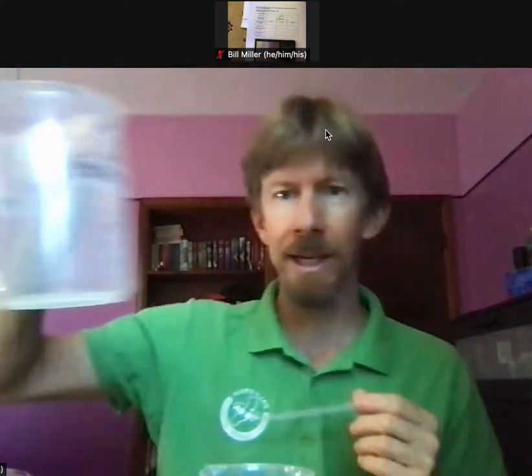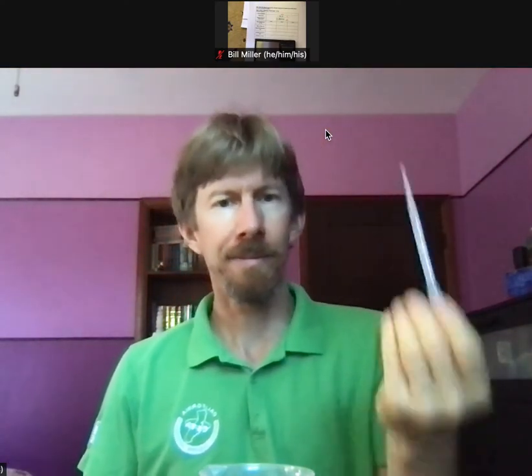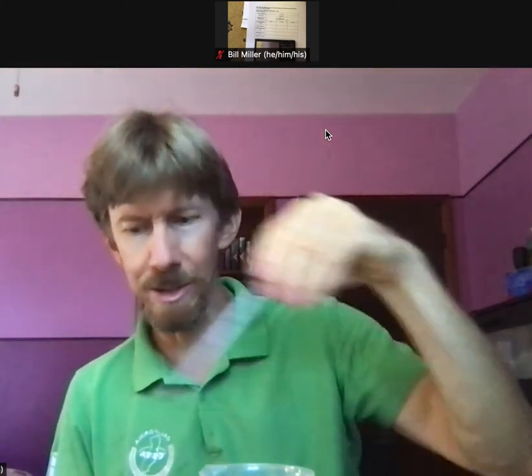Now I'm on number five: condition the pipette with distilled water. I've got my waste beaker here. I'm going to suck a little bit of water up and take it all the way into my pipette, rinsing the entire thing with distilled water three times. That's always what conditioning is — whether it's a pipette or a burette, you're always rinsing three times with the solution you're going to put in there.